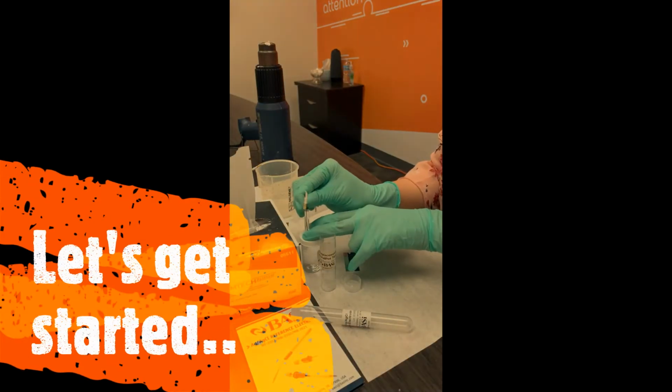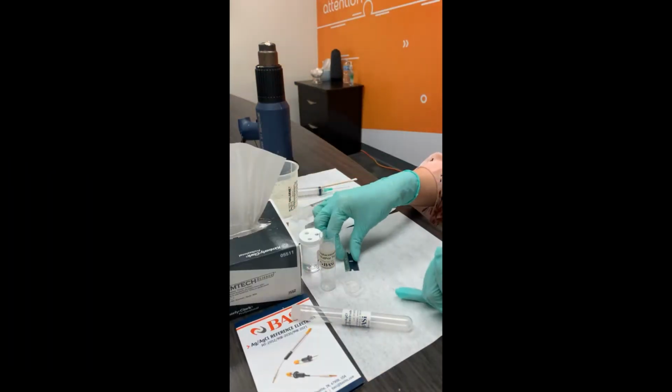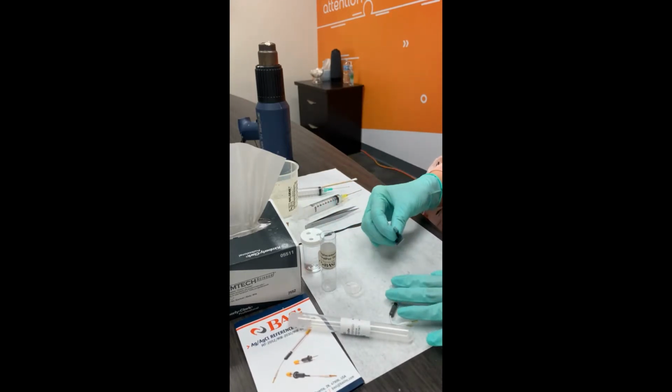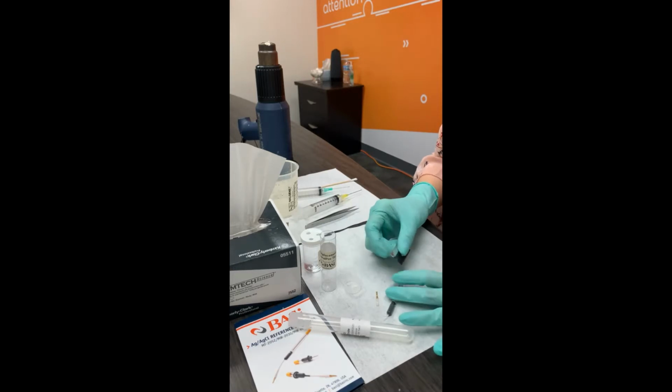First, grab your reference electrode. And what you're gonna do is make a cut at the bottom. Essentially, you're gonna want to cut the plastic portion of your frit.